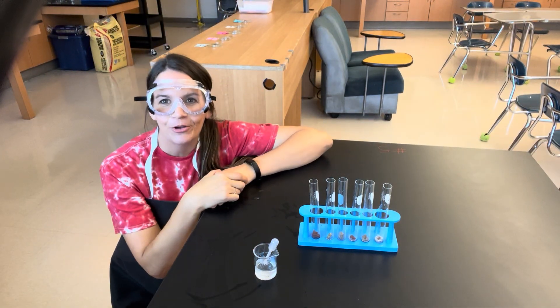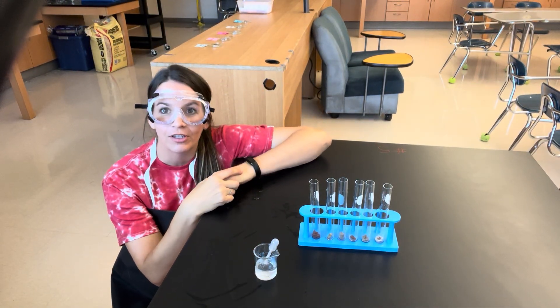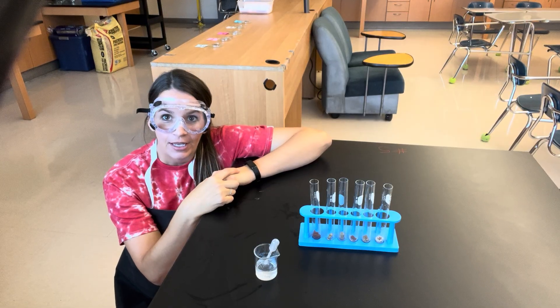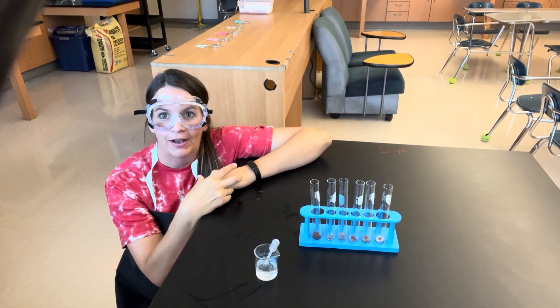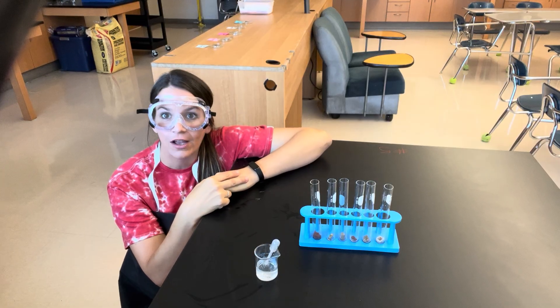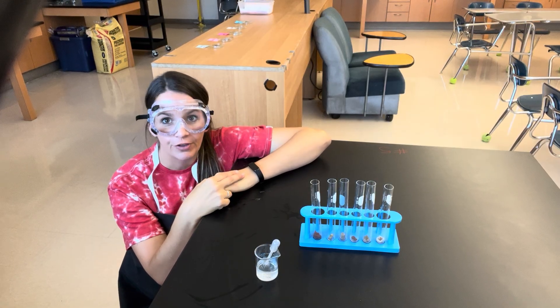Hi guys, today I'm going to be showing you a demonstration of the liver enzyme lab. Liver is a tissue that's found in humans and all sorts of other animals. For the sake of this lab, we're going to be using beef liver.